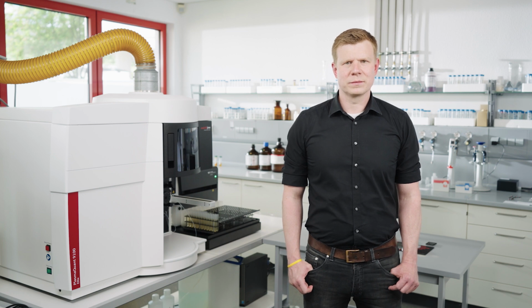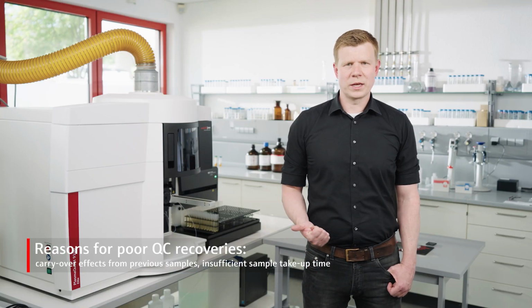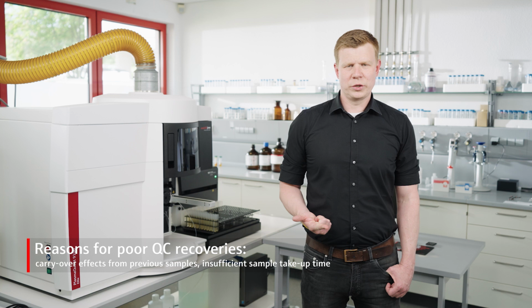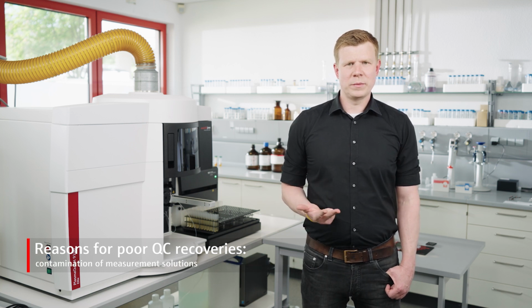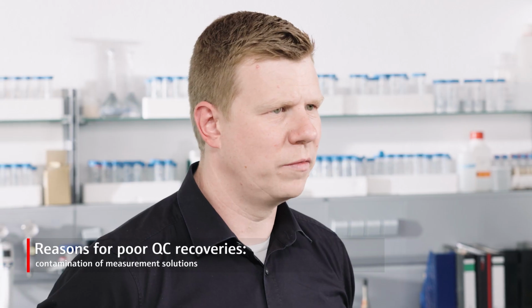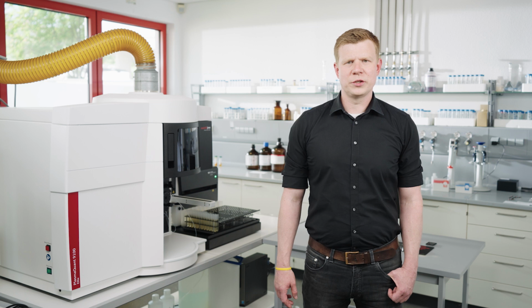used chemicals. The following reasons can result in poor QC recoveries: carryover effects from previous samples or calibration solutions, insufficiently long take-up time of the measurement solutions, or contamination of the measurement solutions from chemicals, vials, or sample tubing. If QC samples are in general not passed, it is advised to review the method settings and the sample preparation procedure. In our measurement, all quality criteria are met and we have successfully finished the measurement.